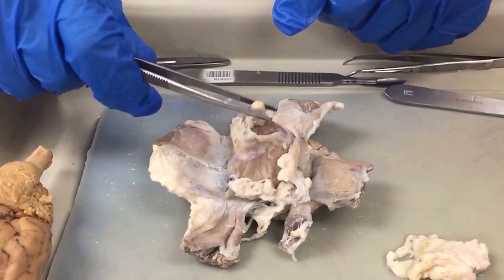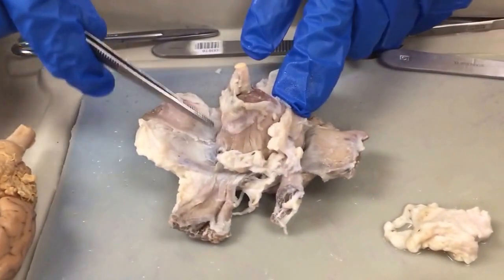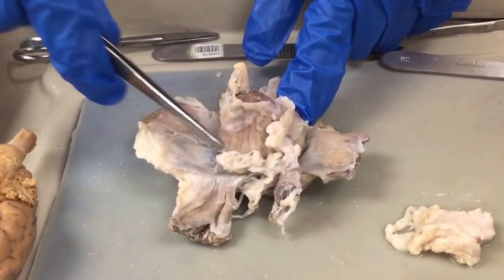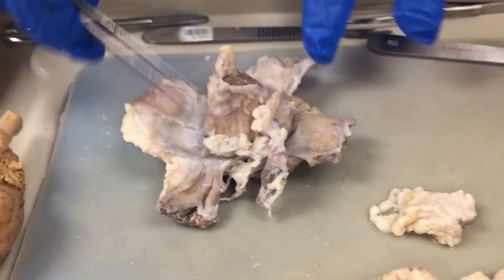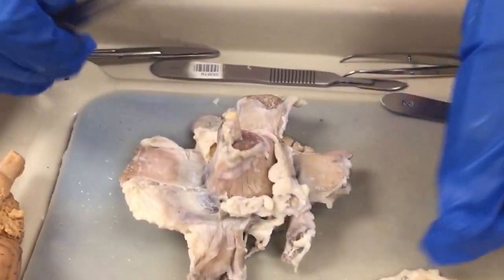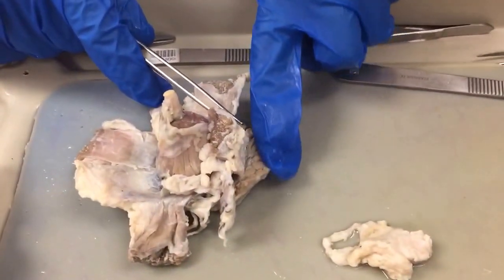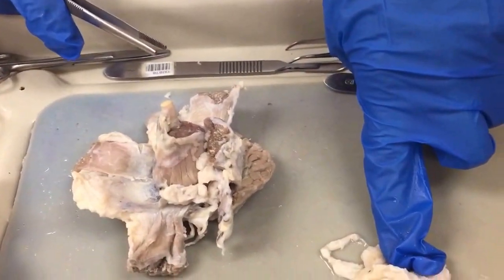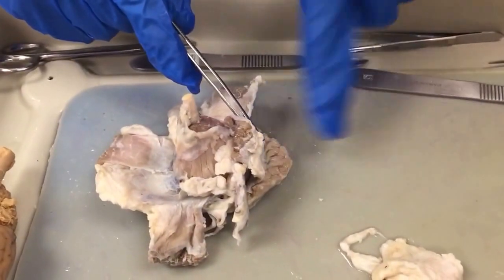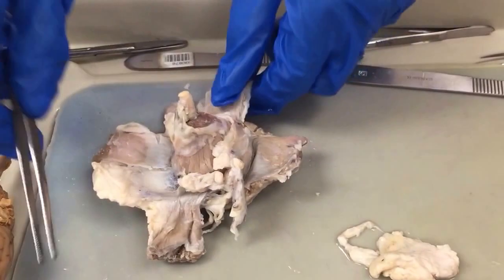Okay, so obviously we have the large optic nerve here coming out of the back of the eye. This muscle surrounding the back part of the eye is the retractor bulbi muscle. Those 2 things are super easy. Then we have the lacrimal gland here. You can see how that's spongy glandular tissue, different than the fat that we cut off, and different than the muscular tissue here. The lacrimal gland is very distinct. Some of you may or may not have the lacrimal gland in yours.